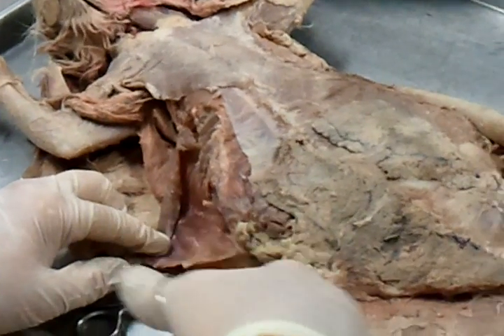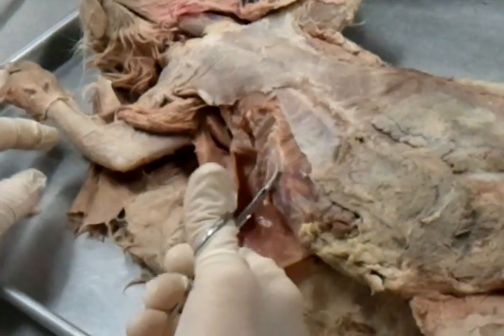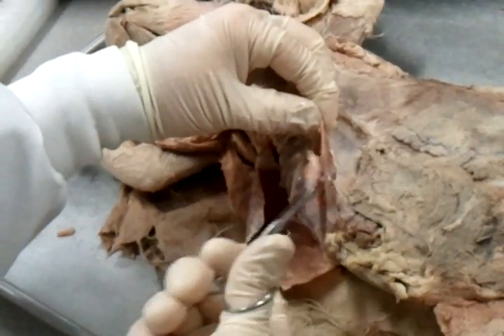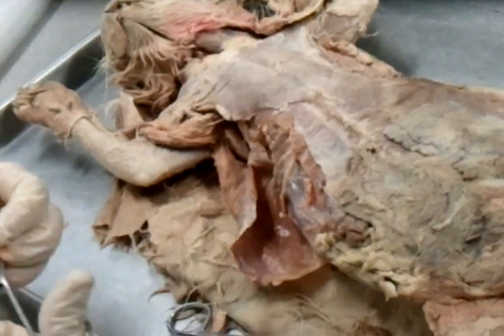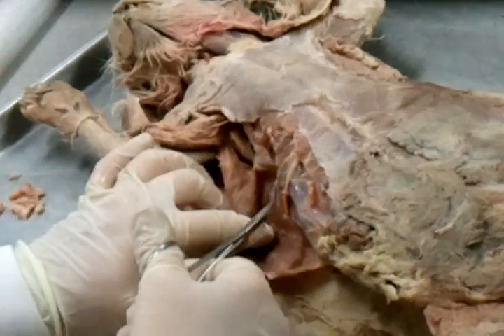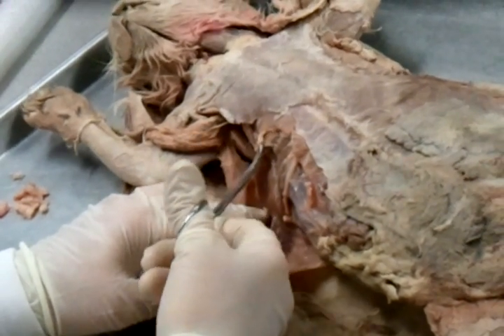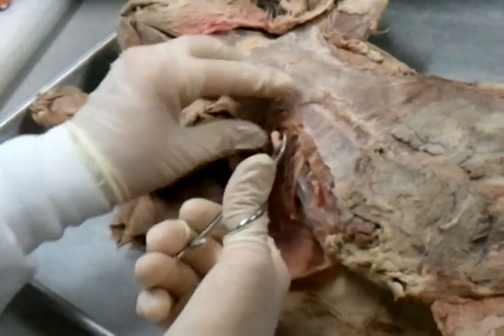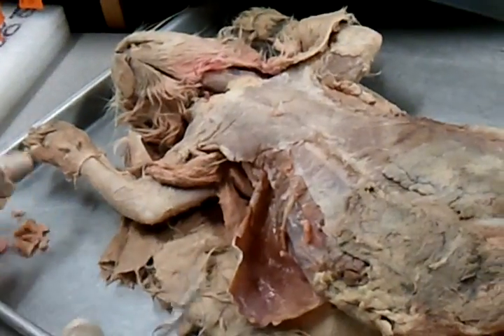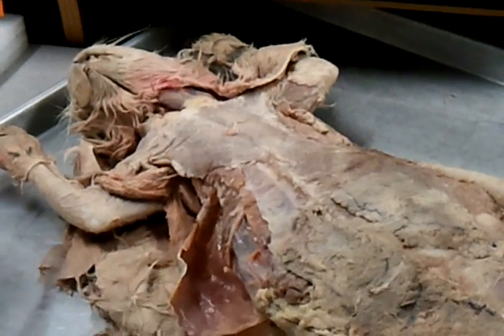You can sort of see your internal oblique here, because I got down to it — now I'm not on ribs anymore. We're not dealing with external and internal intercostals — we're just identifying intercostal muscles. Where are they found? Between ribs. There's actually two layers: the outer layer is external and the next layer is internal. But the cat's so small to see that level of detail. I'll show it when we do respiration in the humans — I'll show you what it looks like. Those are intercostals.